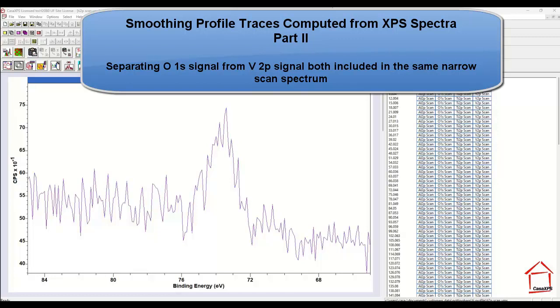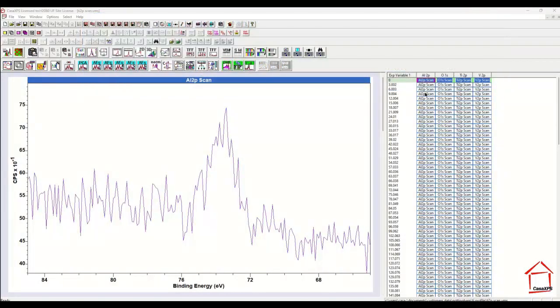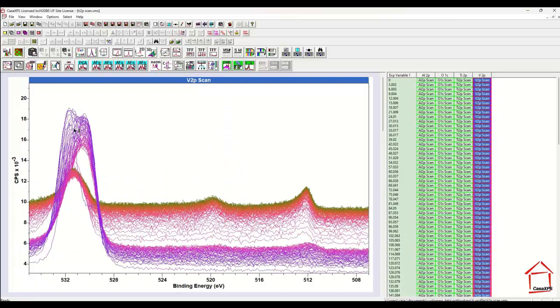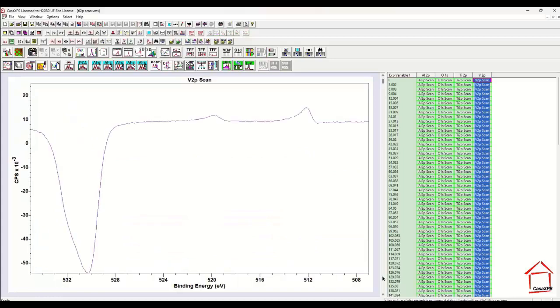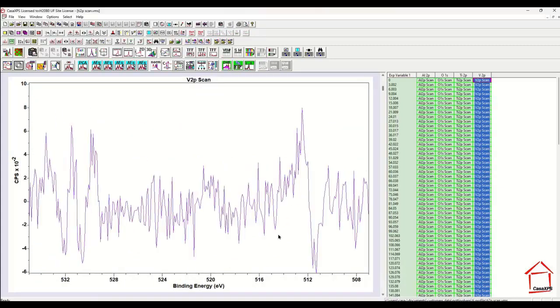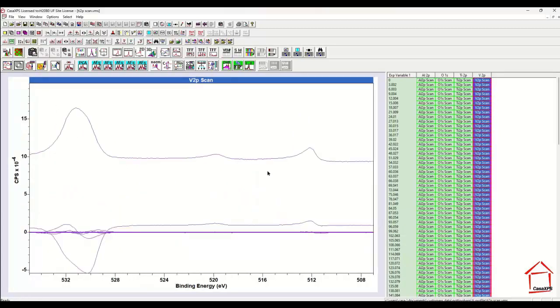In this video I'm going to return to the subject of improving the quality of a depth profile calculated from XPS spectra. In this case I would like to look at a spectrum measured that is nominally the vanadium 2p, but the interval includes oxygen 1s also. And this has consequences when we want to do noise reduction, because if we perform principal component analysis we end up with a significantly higher number of abstract factors, 6 at least, because of combining the oxygen with the vanadium.